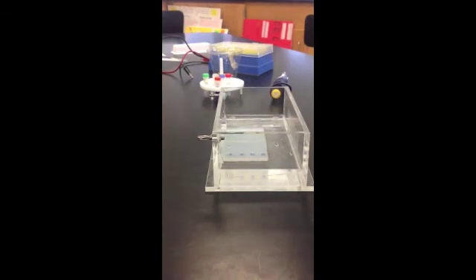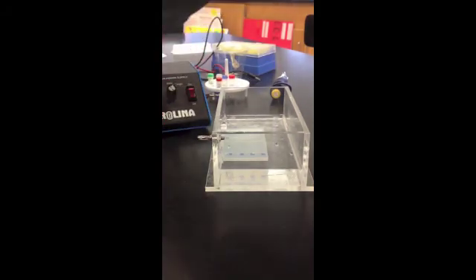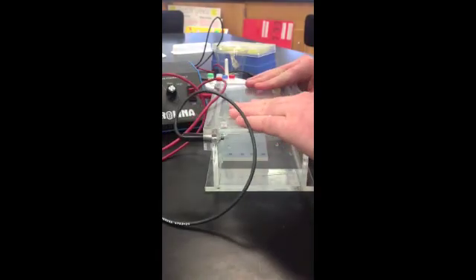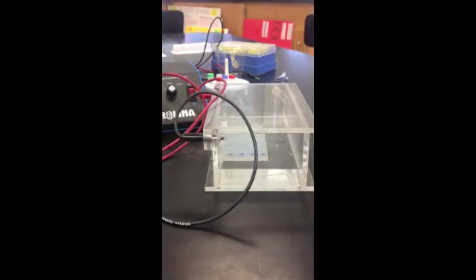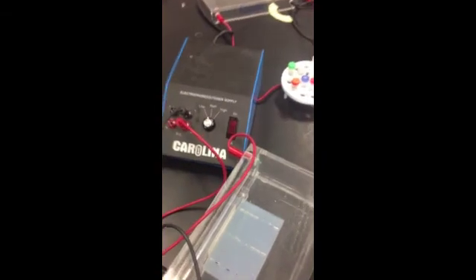So what we're going to need is our power source right here, and we're going to need the top that has the electrodes connected to it. So this top just slides right onto the chamber. So now the chamber is connected to the power source. I'm going to put the power source on medium. Some of them will have just low, medium, and high, and some of them will have like actual voltage that you have to control. So we'll put it on medium, and we're going to throw it on. The light is on indicating that it's on.